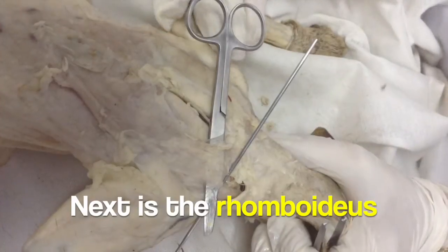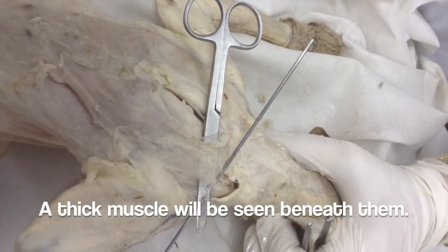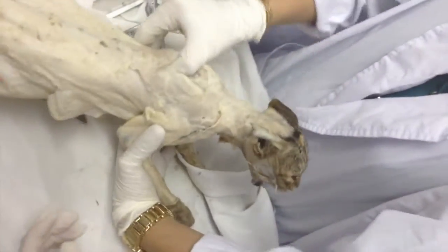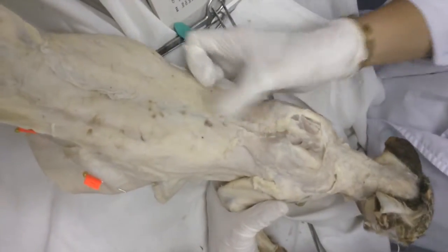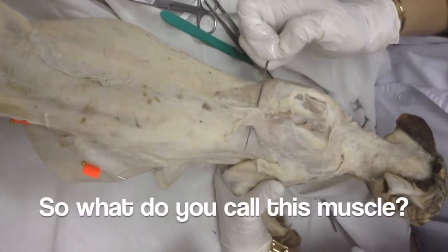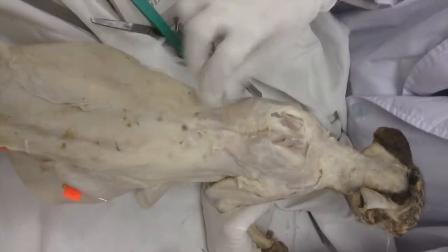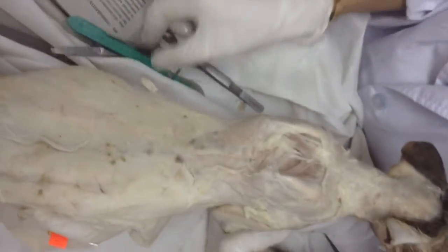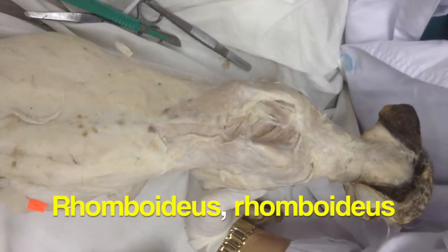Next is the rhomboideus. Cut across the middle of the bellies of the spinotrapezius and acromiotrapezius muscles — a thick muscle will be seen beneath them. This is the rhomboideus.